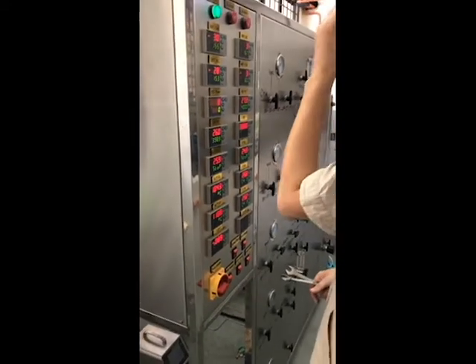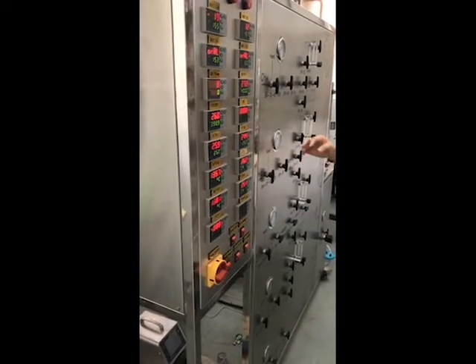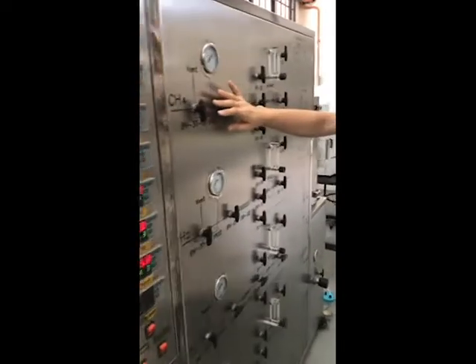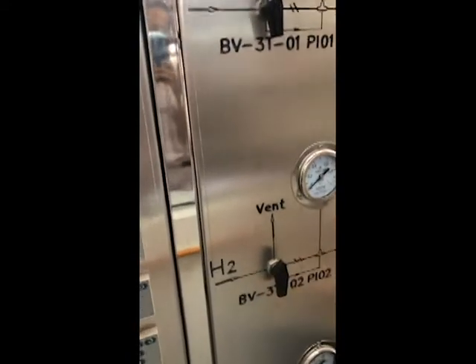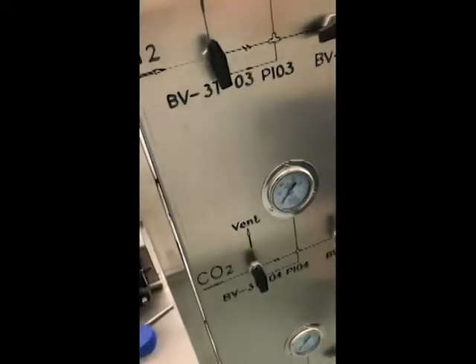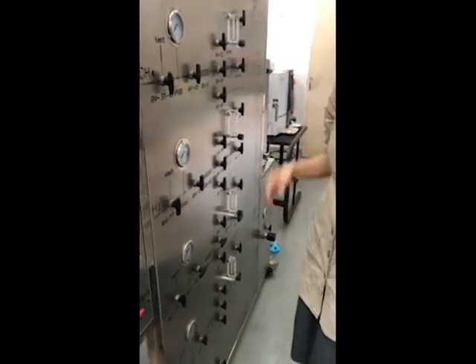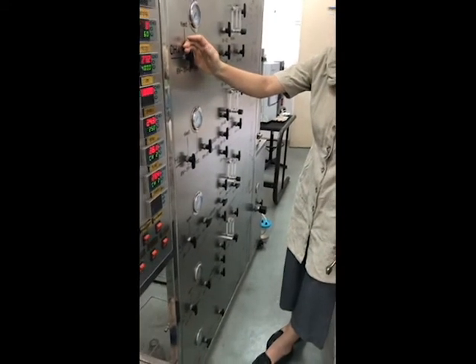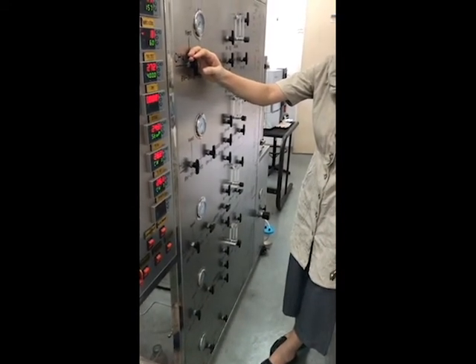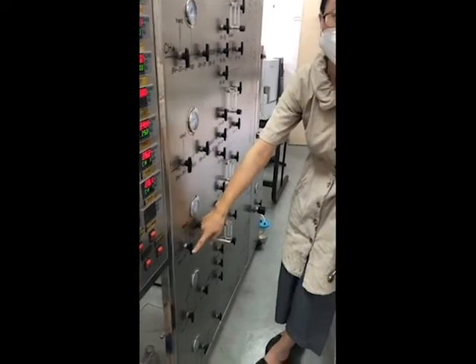At the beginning, we will not start to set the temperature. We will send the gas first. If you can take a record of this, we can see this. We installed 5 gas lines: 1, 2, 3, 4, 5. With the 5 gas lines, we can conduct quite several reactions with this reactor. Like with only methane, we can conduct methane cracking. Methane cracking means you only use methane, hydrogen, and nitrogen.